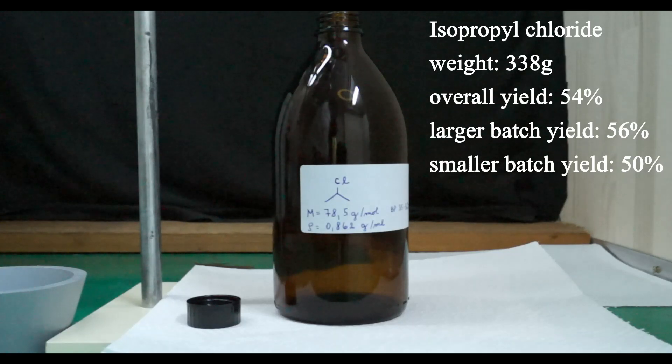Since all the reagents used in this preparation are rather cheap I'm quite happy with the yield. I believe that the majority of the losses can be explained by the following. If you recall at the beginning I stopped collecting the crude product after eight and a half hours.